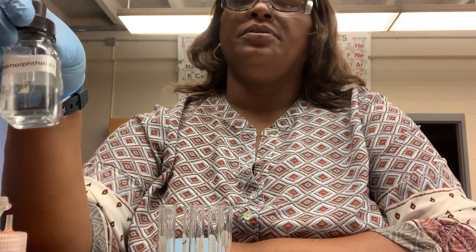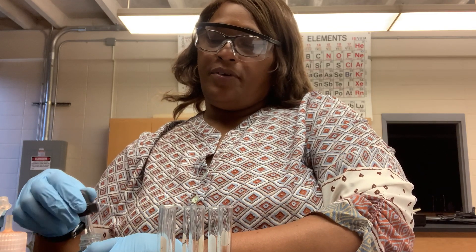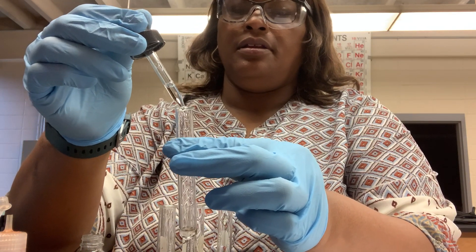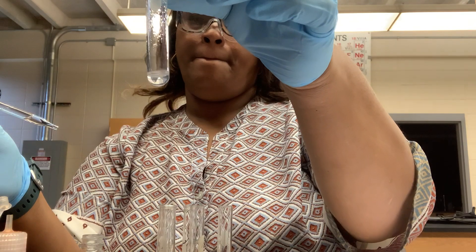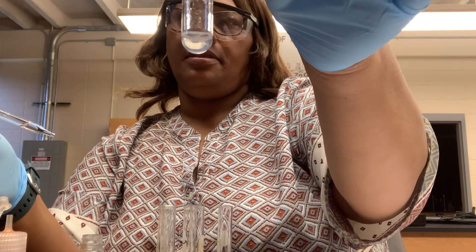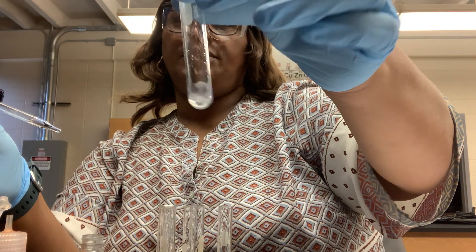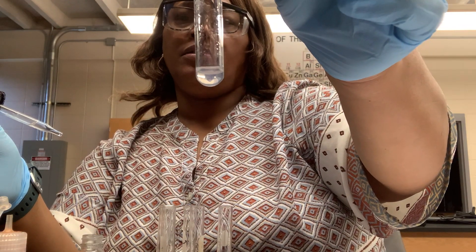Next, we're going to test each of those three same liquids, but this time with the phenolphthalein indicator. First, the tap water with phenolphthalein. Note any color change. If there's no color change, you'll say it's colorless. And if you can still see through the solution, then it's also clear.